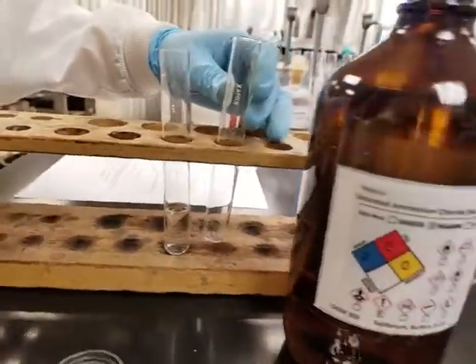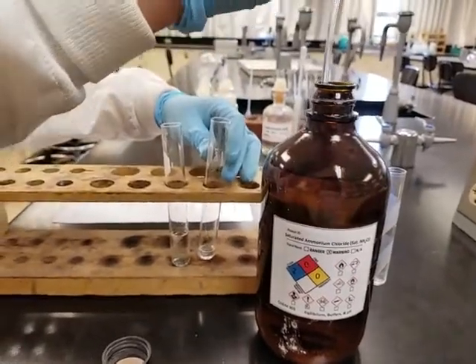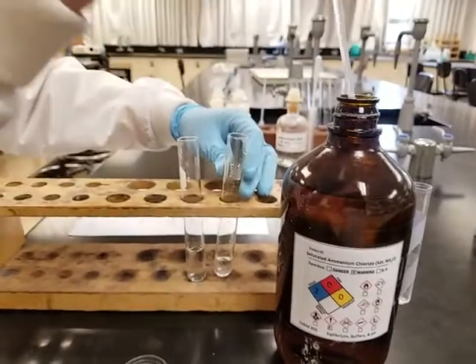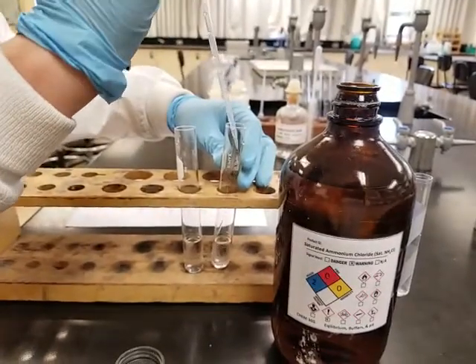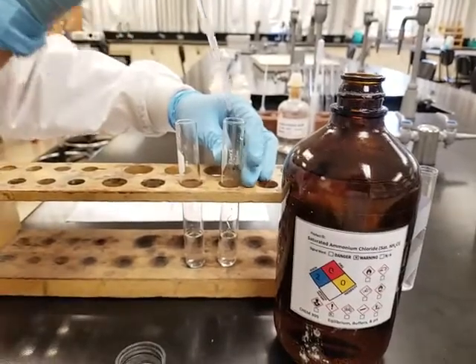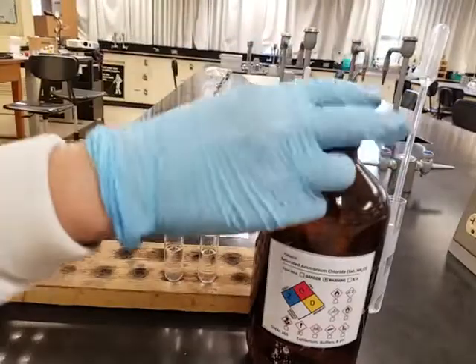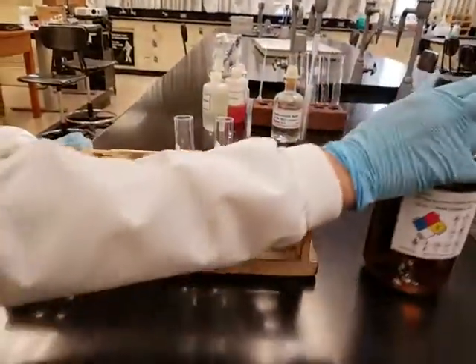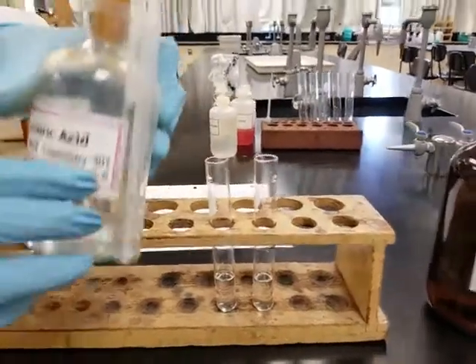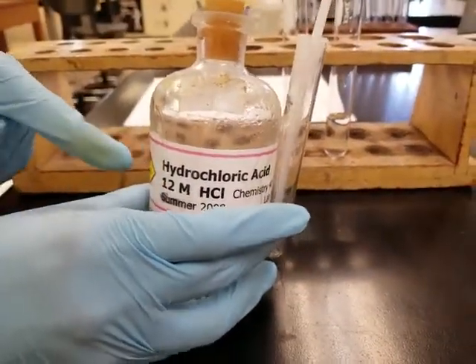And we're going to have a comparison because sometimes it's good to find out what happens. So I'm going to have another test tube, which is just my control. It's just another test tube to let me have a comparison. If it's a subtle change, I can still see it because I'm comparing it to the original solution. So here are 2 identical ammonium chloride solutions, but we're going to do something to the first one. According to the lab manual, you are to introduce hydrochloric acid, 12 molar, very acidic, very dangerous.